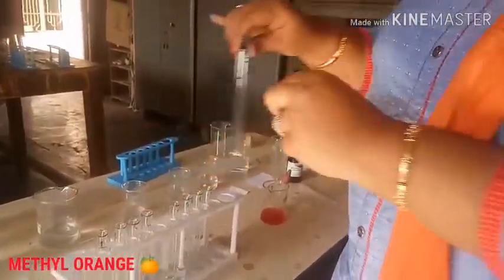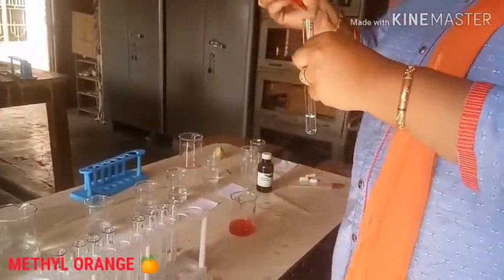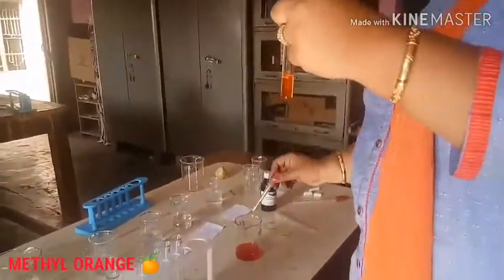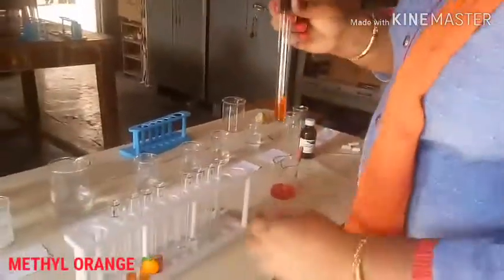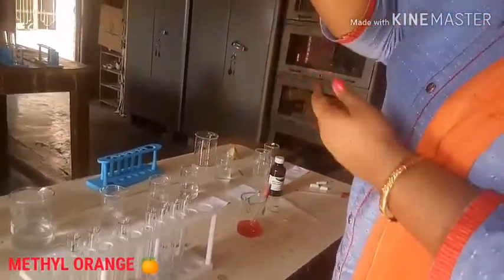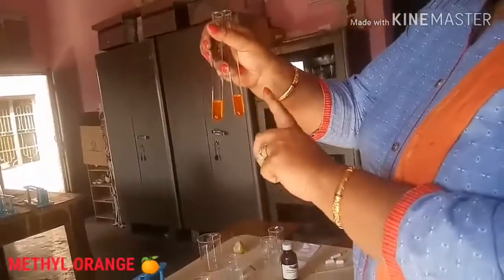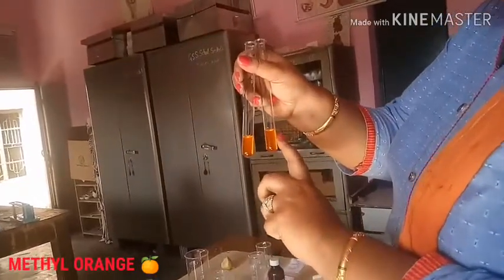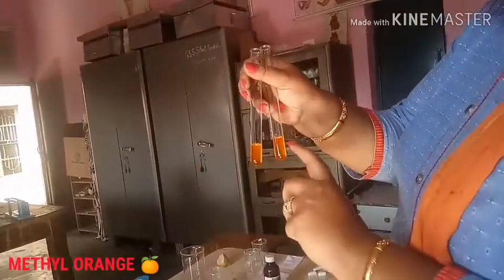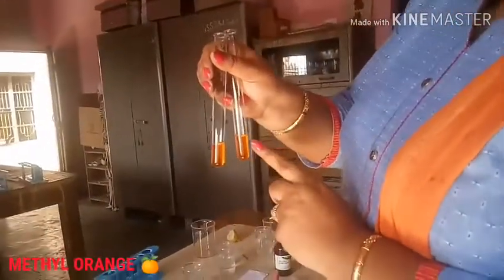Now the fifth sample is sodium hydroxide. I put the same drops in. It is also of yellow color. Comparing the colors: sodium hydroxide gives a bright yellow color, but it is slightly lighter compared to the sodium carbonate which is darker.